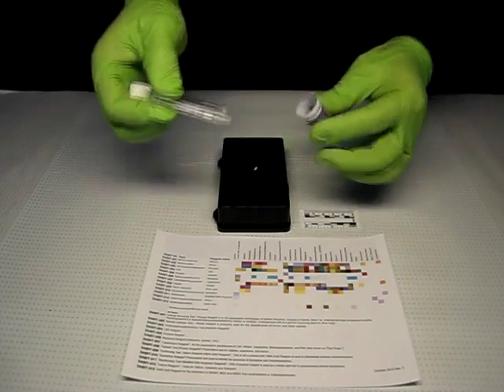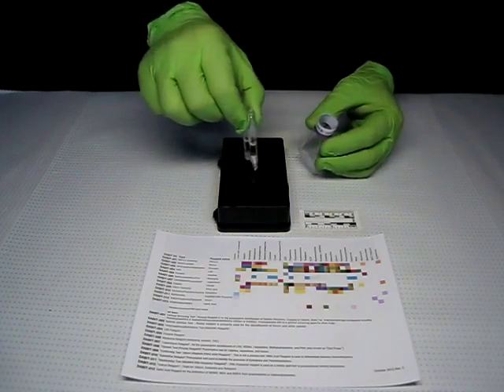Dab the sticky sampler tip on the material to be tested, collecting as much of the material as possible.